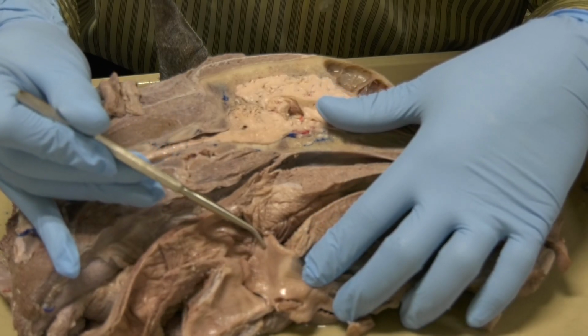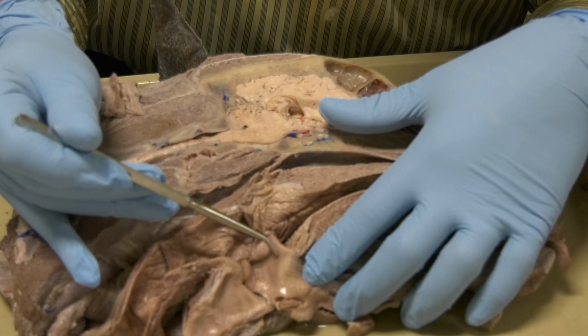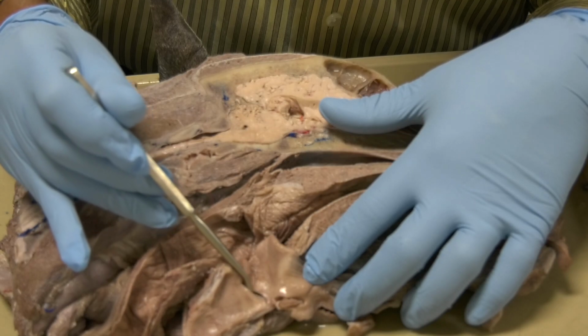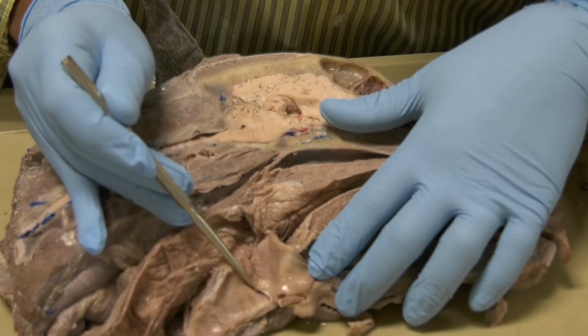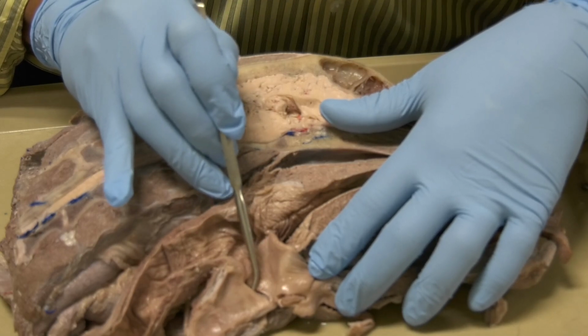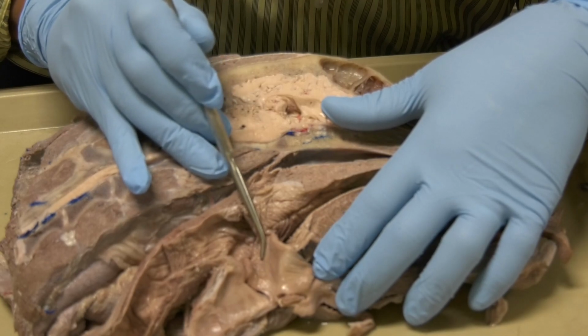The area from the entrance of the larynx, all the way from the tip of the epiglottis, all the way to the vocal fold, right? This is the vestibule of the larynx. Okay? The space in between the vestibular fold and the vocal fold, where I'm putting the probe here, this is the laryngeal ventricle. Okay?